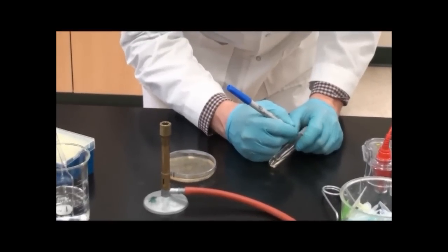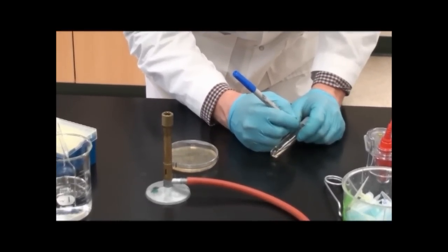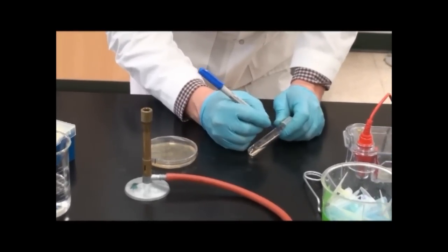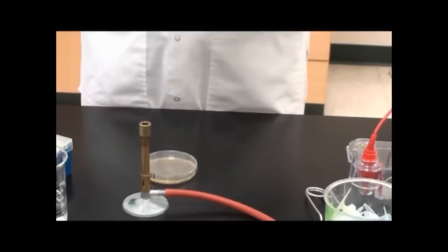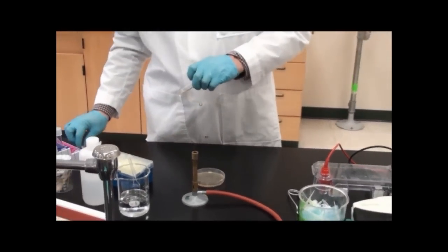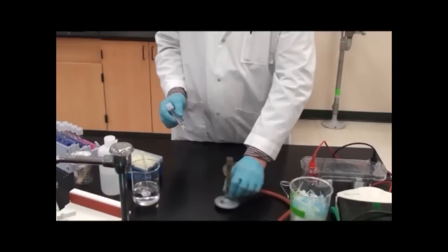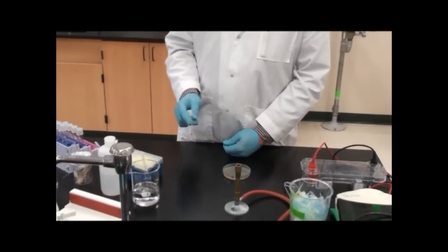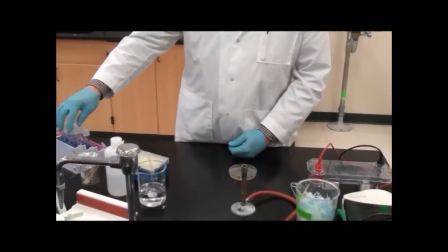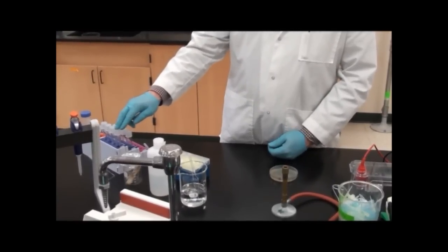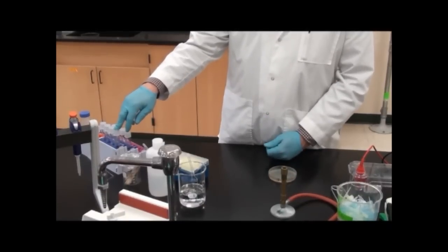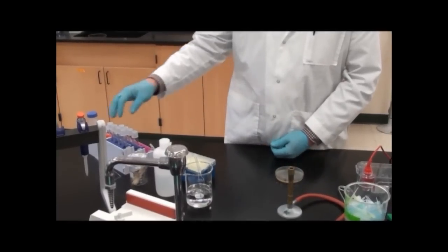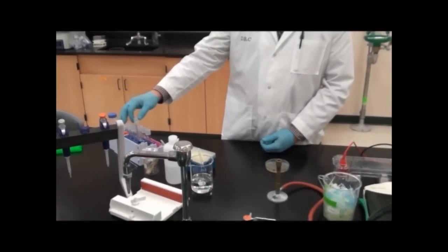This is 2-4, PQE 31 GFP. This culture tube only needs to grow for about 16 hours. If I've selected my colonies before 5 o'clock, I'm just going to put them back in the rack. The toothpick will show it's been used so no one else will use it. Later on, we'll put this into the shaking incubator at 5 o'clock. If you're doing it right at 5 o'clock, I just walk this directly back to the shaking incubator.